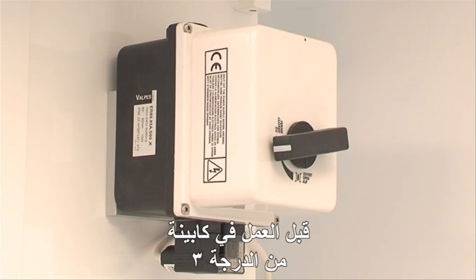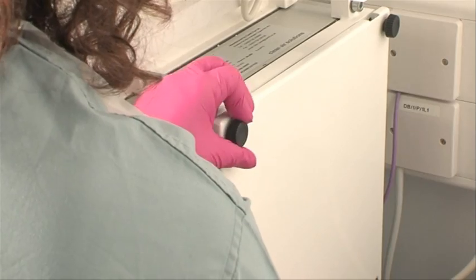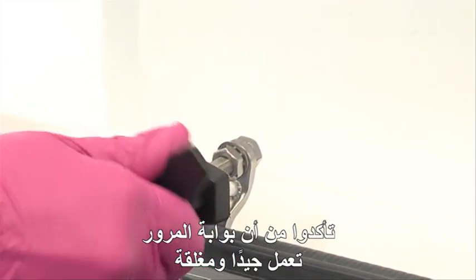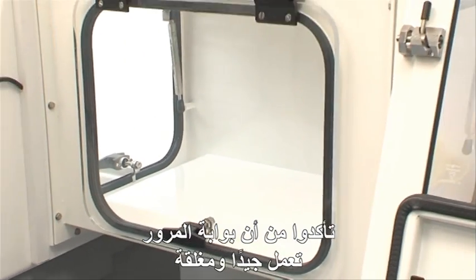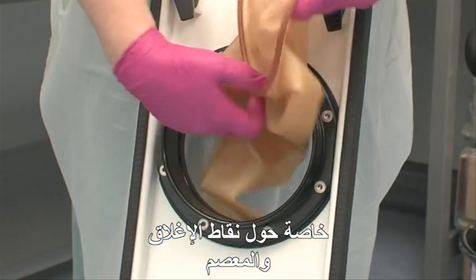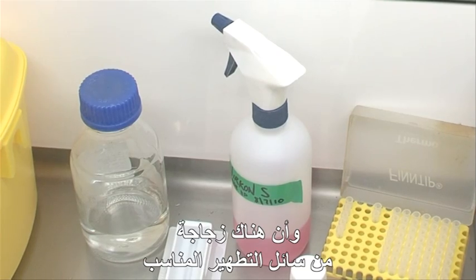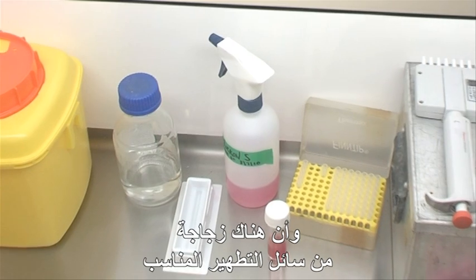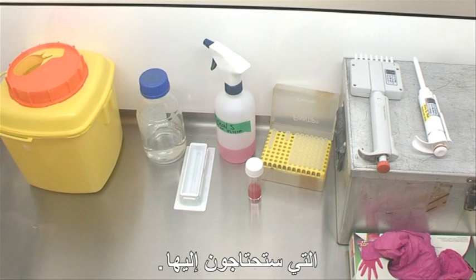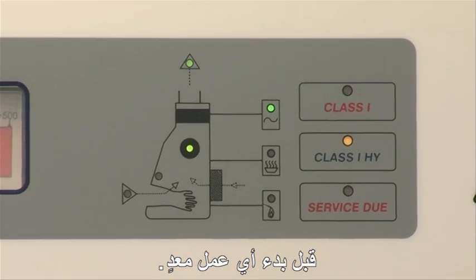Before working at a class 3 cabinet, make sure all dampers are in the correct positions and that all necessary air intakes are open. Check the pass hatch is fully operational and closed. The integrity of the gloves has not been compromised, especially around the seals and at the wrist cuffs. Ensure there is a bottle of the appropriate decontamination solution placed inside the cabinet along with all the equipment you are going to need. Make sure the pressure dials are in the safe working zone before you start any infectious work.